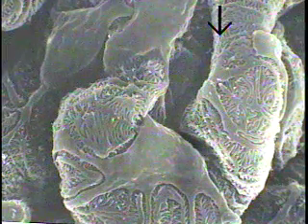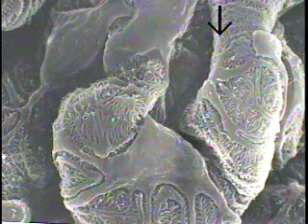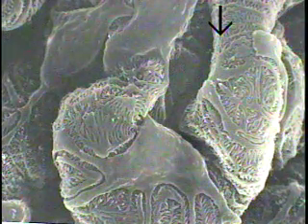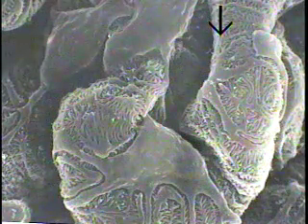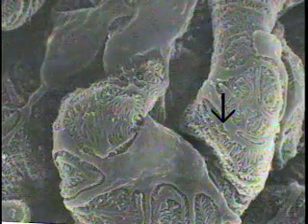This is a scanning electron micrograph of podocytes forming the visceral layer of Bowman's capsule. This scanning electron micrograph is courtesy of P. Andrews of Georgetown University. This micrograph beautifully illustrates a glomerular capillary which runs in this direction, curves around and comes back at that angle. Completely investing and surrounding this underlying glomerular capillary, one can see the pedicels and the secondary and major foot processes of the podocytes as they wrap around the underlying capillaries.